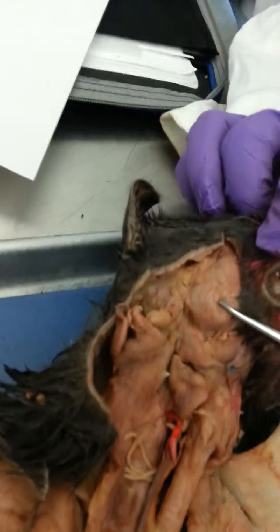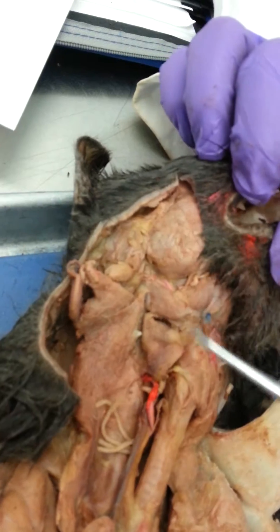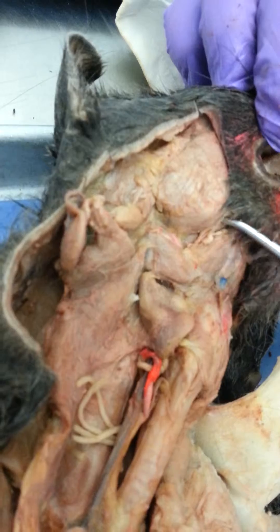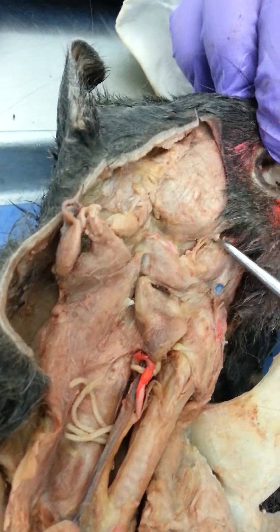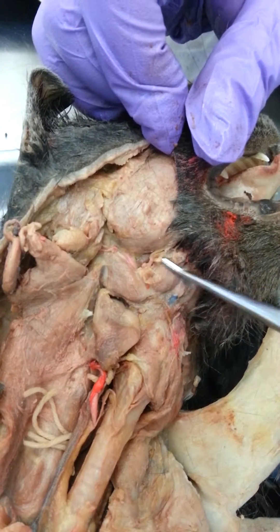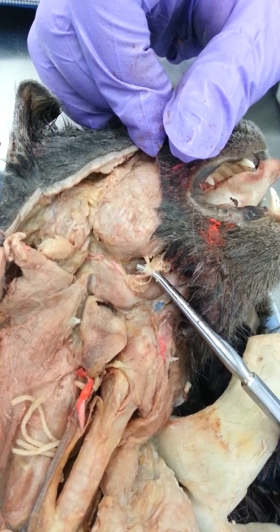There is the parotid gland here, the mandibular gland down here, also known as submaxillary. That little white thing there — you can lift it up. You can see here. That is the sublingual gland.